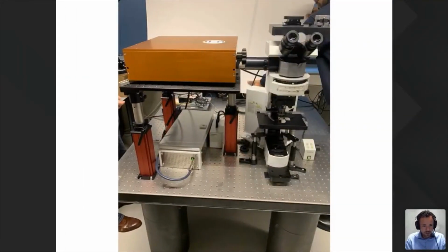I mentioned in the beginning that we also fit upright microscopes. Here you can see the RCM being raised to the level of the C-mount by some legs, and then we can fix this to an optical table, and this makes the RCM also suitable for upright microscope systems.